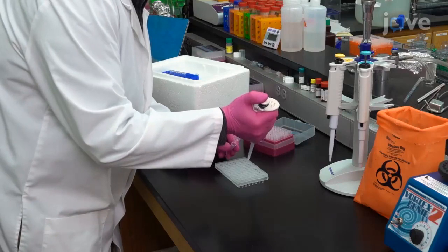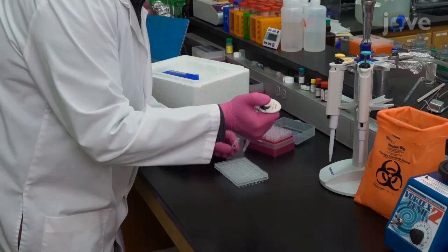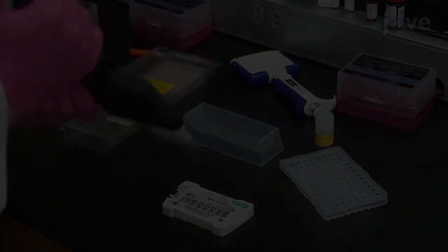Repeat these steps to create digital PCR reactions for each barcoded genomic DNA sample. Generate droplets for each sample.